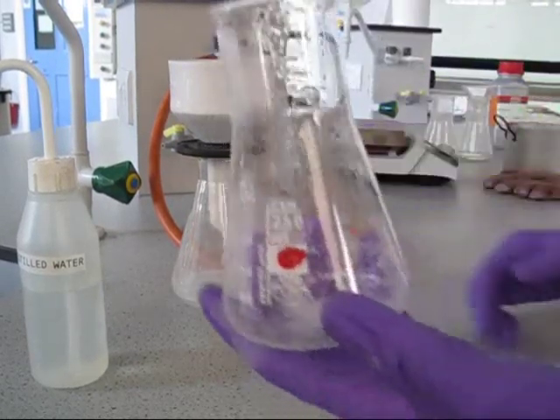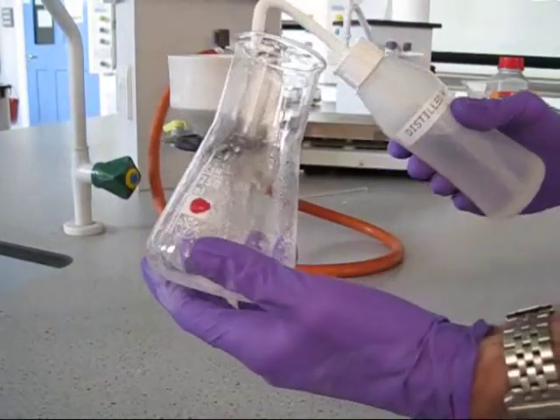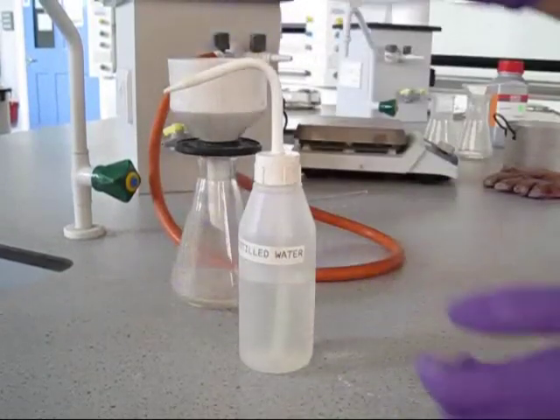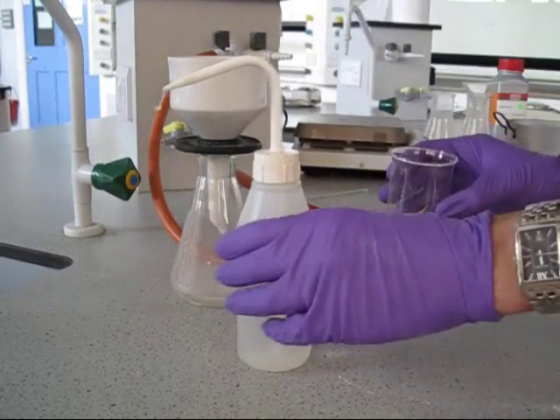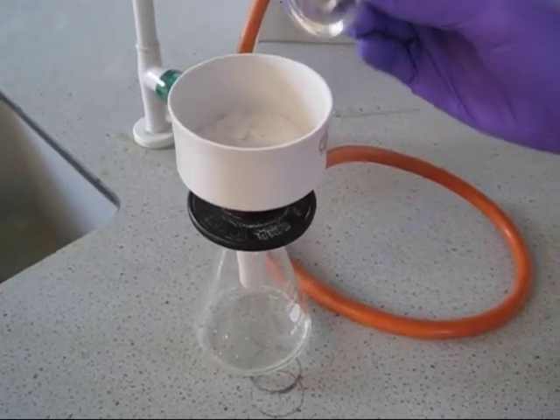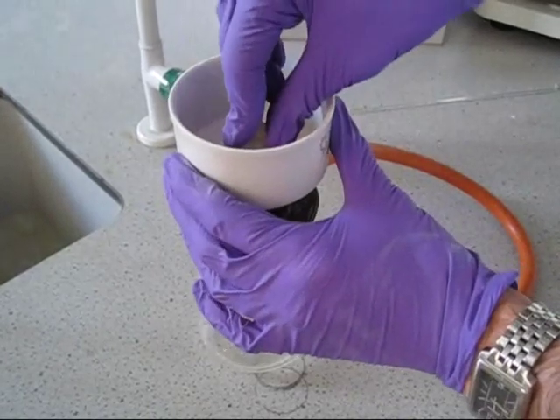If you have any remnants inside your conical flask, you could wash them out using the cold solvent. Once your product is filtering, you can extract the maximum amount of water by using a glass stopper and pressing the crystals down.